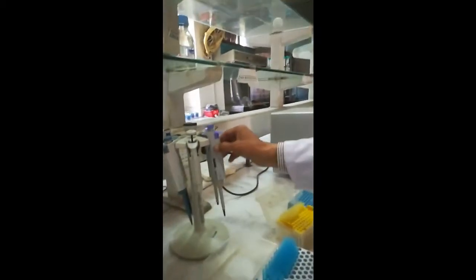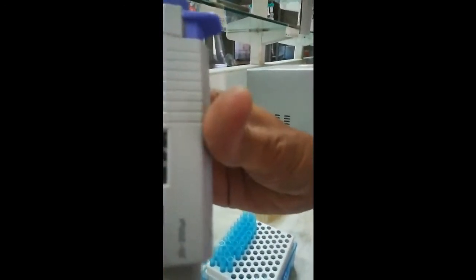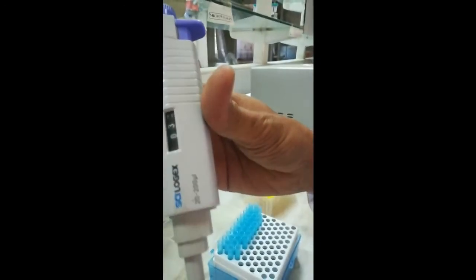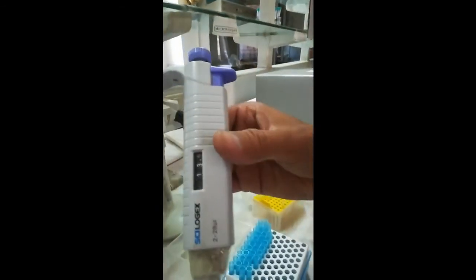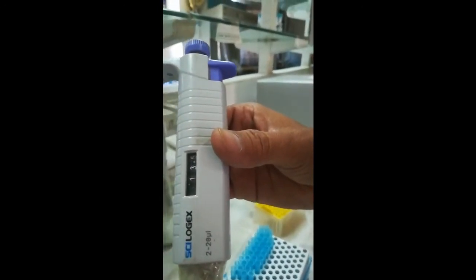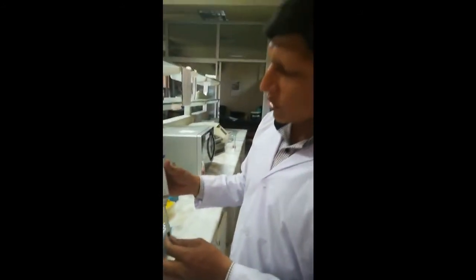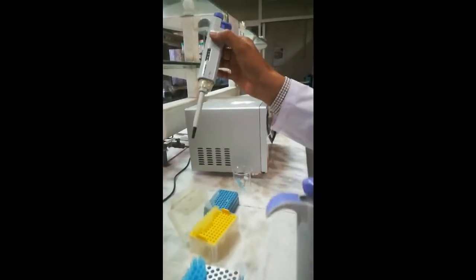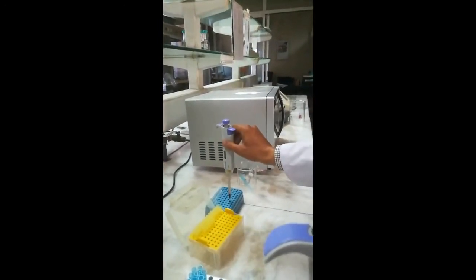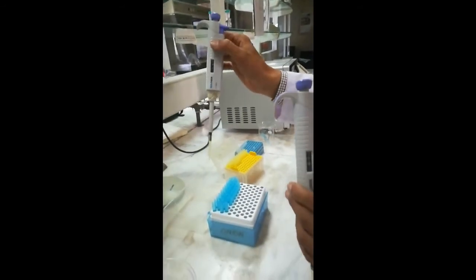Similarly, we have pipettes of different capacities. This pipette has a capacity of 20 to 200 microliter, and another has a capacity of 2 to 20 microliter. For the 20 to 200 microliter pipette we use yellow tips, and for the 2 to 20 microliter pipette yellow tips can also be used.